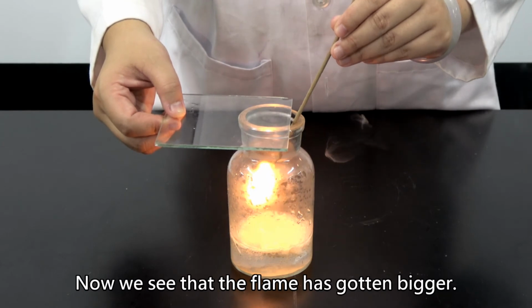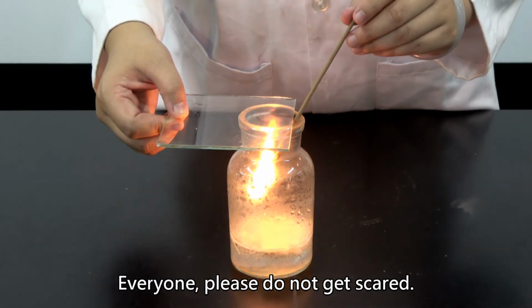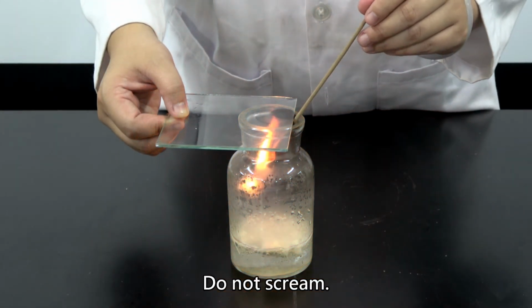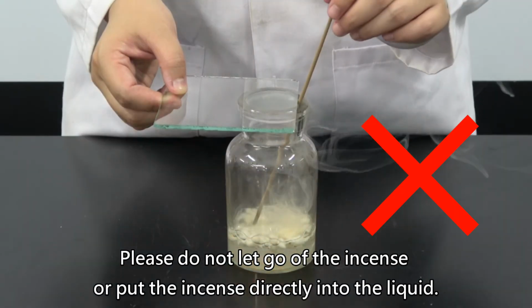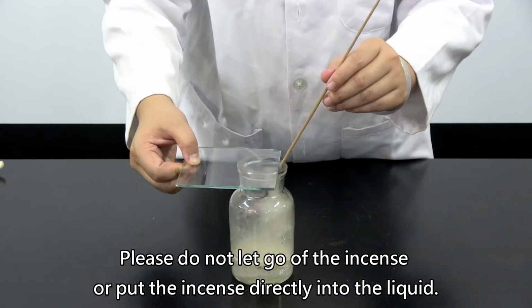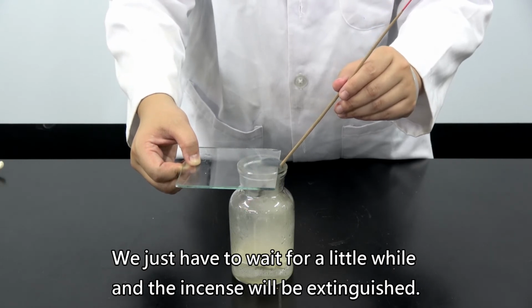Now we see that the flame has gotten bigger. Everyone, please do not get scared. Do not scream. Please do not let go of the incense or put the incense directly into the liquid. We just have to wait for a little while and the incense will be extinguished.